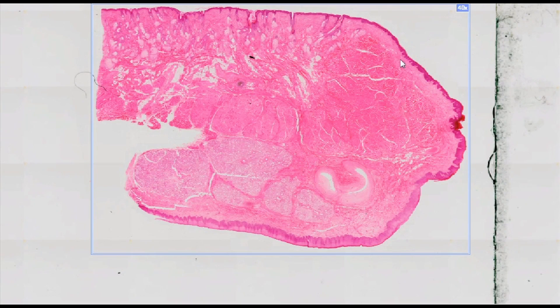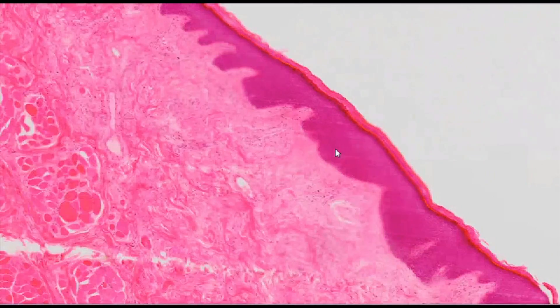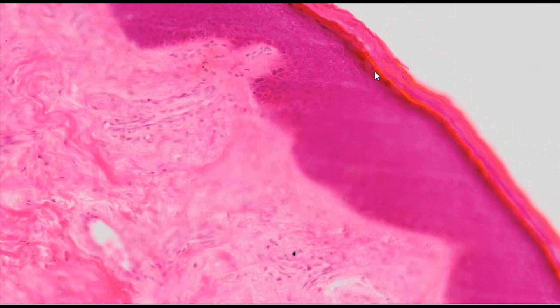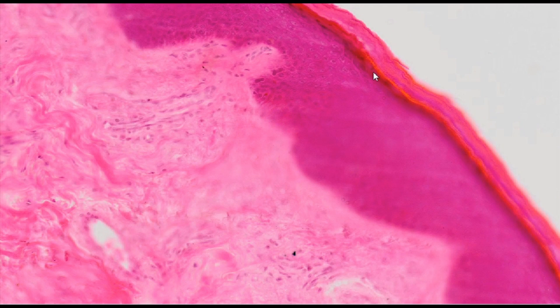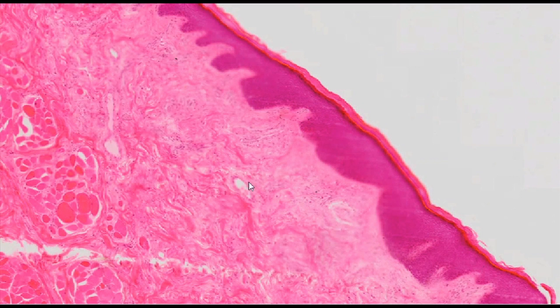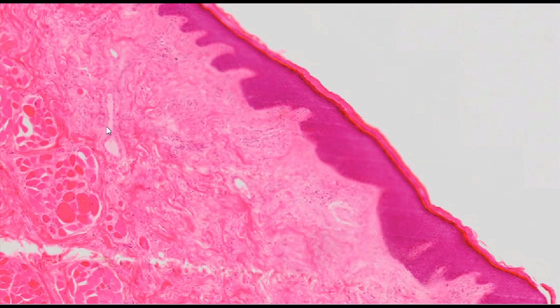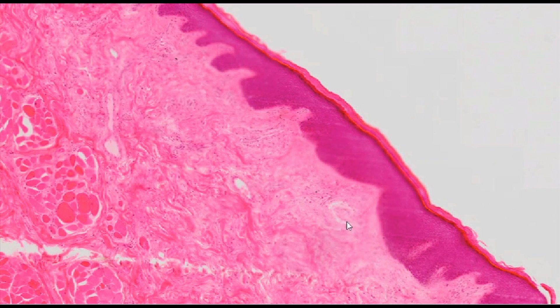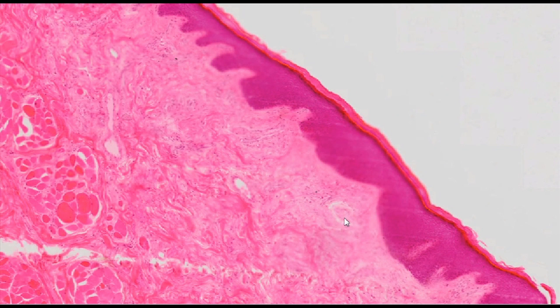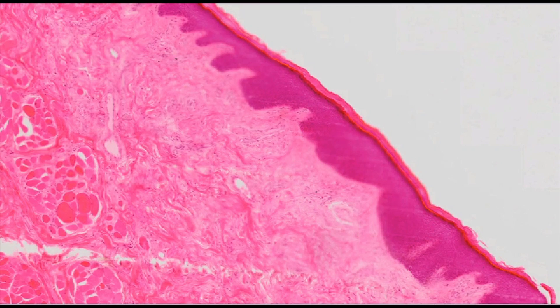The vermilion border, which is a thin stratified squamous keratinizing epithelium devoid of a granular layer, is found between the outer and inner parts of the lip. Here blood vessels appear through the skin of the lips, which leads to their notable red color. Since salivary glands are lacking in the vermilion zone, the lips must be continuously moistened with saliva.